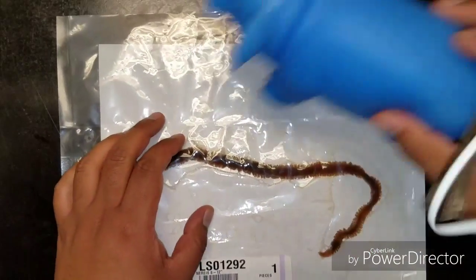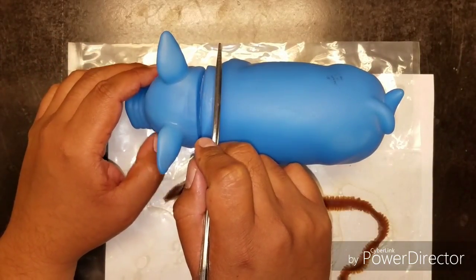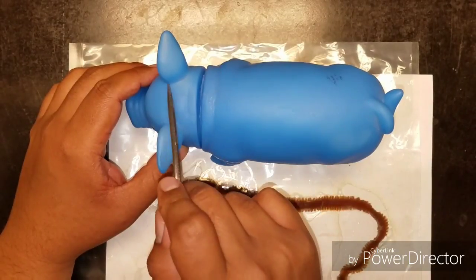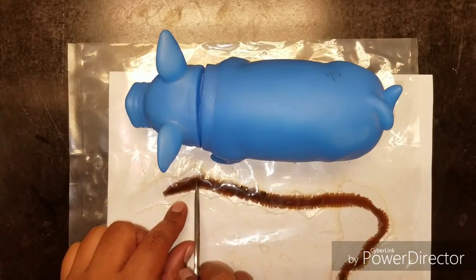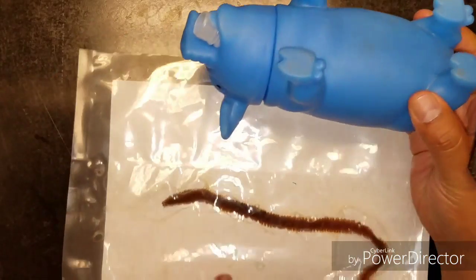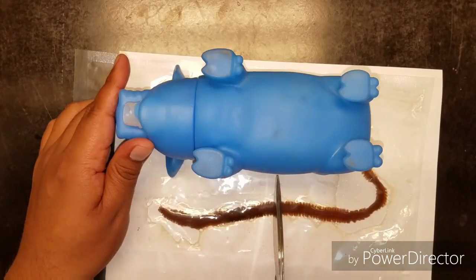Now a transverse cut, let me bring my pig back here. If I asked you to make a dorsal transverse cut near the anterior side, you would just do this. Again, all I'm saying is a dorsal transverse cut side to side near the anterior, like that. Same thing with the worm. If I asked you to make a dorsal back transverse side to side cut near the anterior, it would look like that. If I flip this over, I could now make a transverse cut along the middle, or a transverse cut along the middle here.